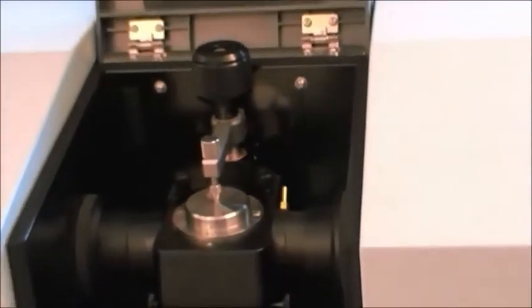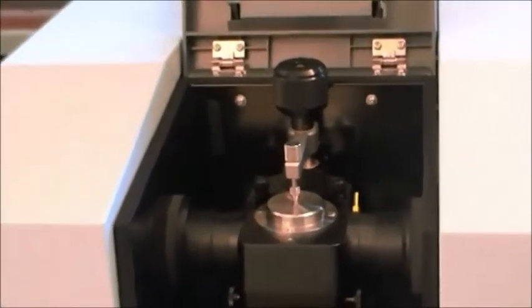But for some, it may not have that. So, you try not to break your crystal. And then twist when it can't twist anymore and it makes that little noise. This one, you don't have to put the lid down just because it has a solid, it's a solid sample and it's already fully covered. And then you just run your background again and get your spectrum.